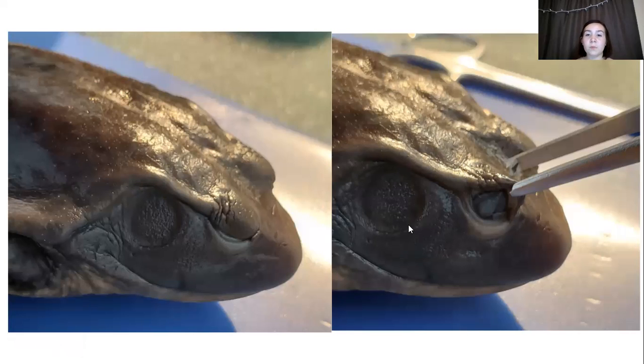Now, the tympanic membrane is similar to an eardrum, and this is how a frog hears. Frogs don't have ears like we do, but we humans have a membrane that works similarly to a frog's tympanic membrane. However, compared to humans, the frog tympanic membrane is much, much more powerful.